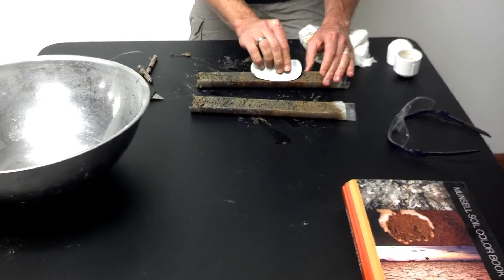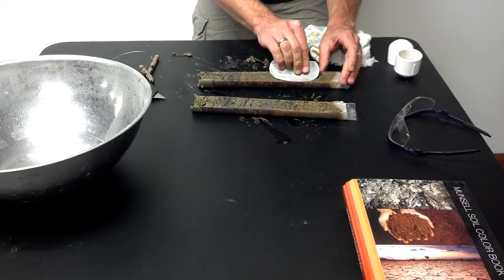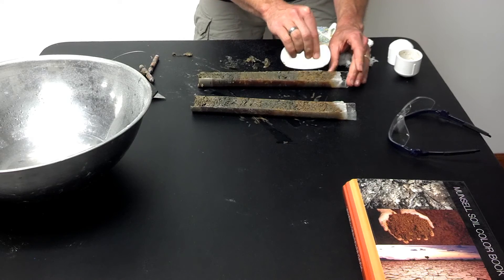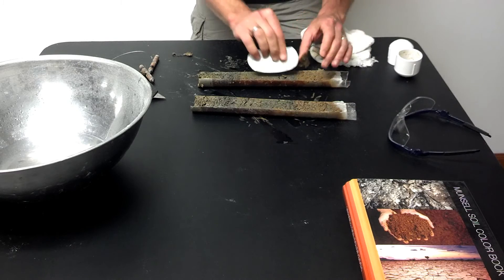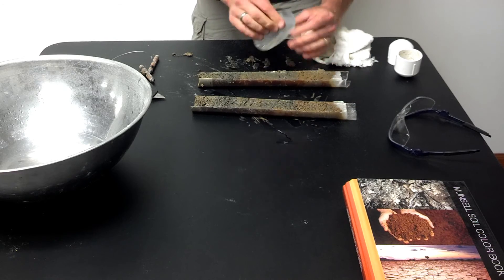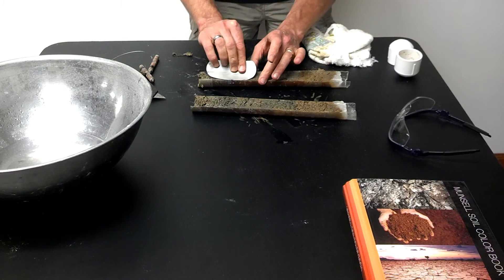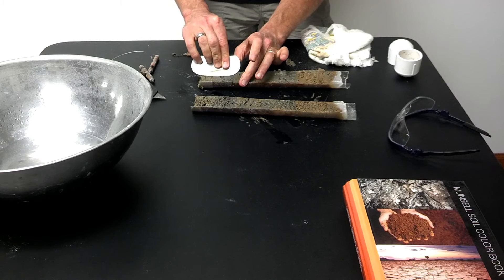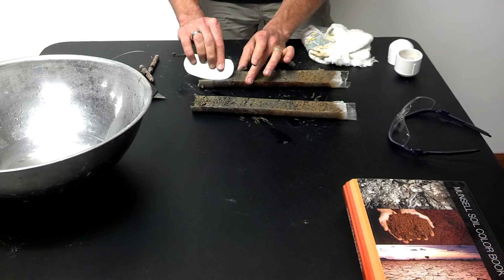I'll have a better view of the samples and the different textures and the different layers within the single sample. I'll scrape across, removing just a fine layer of sediment horizontally across the core half.